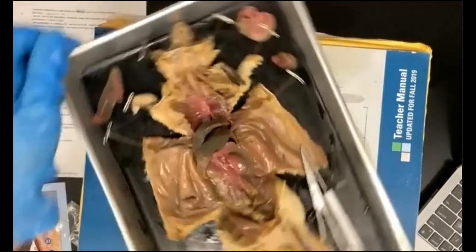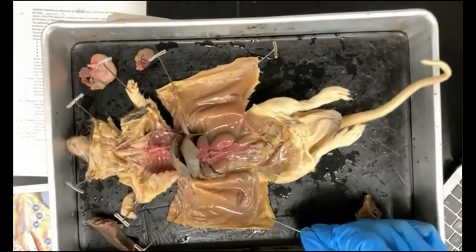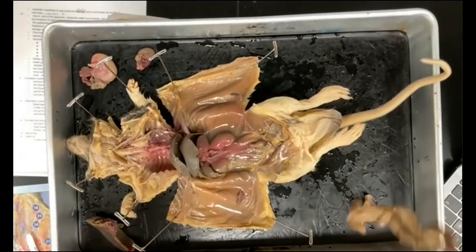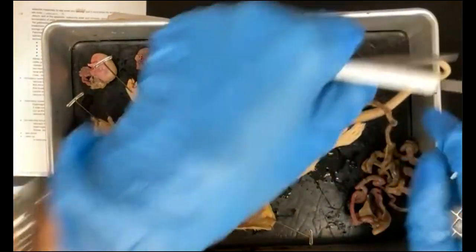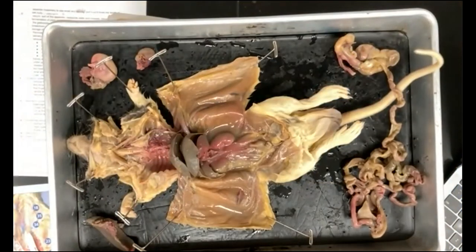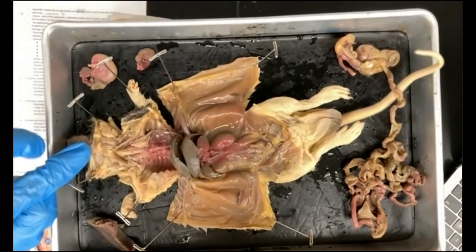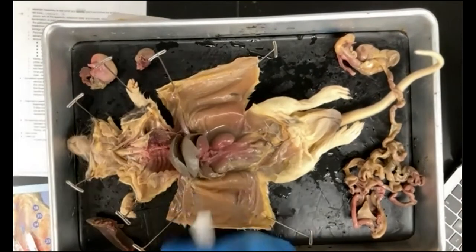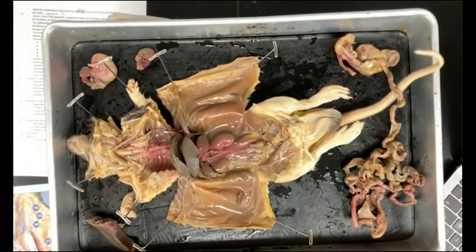So once you have everything set out like this, then you'll want to do your photo shoot. So get your intestine back, get it all nicely arranged so that you can show the large intestine and label that on your photo, and the small intestine and label that on your photo. So make sure that the kidneys are showing, and the liver, of course, will be showing. Make sure that you have a salivary gland showing as well, and that your trachea is also visible, and your esophagus, remember, is right next door to it, is also visible. And take your photo.